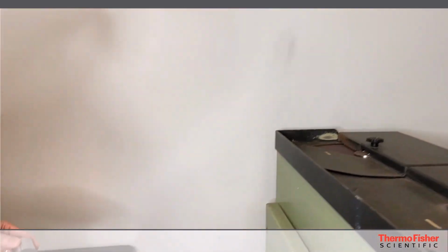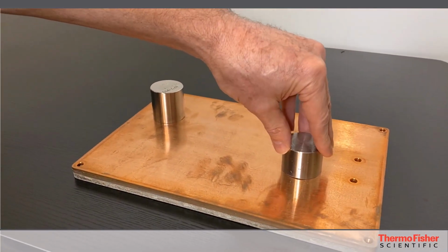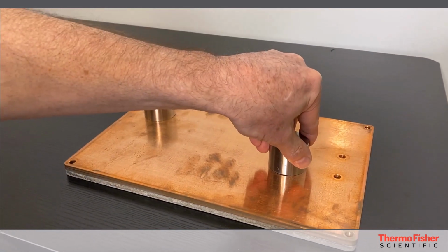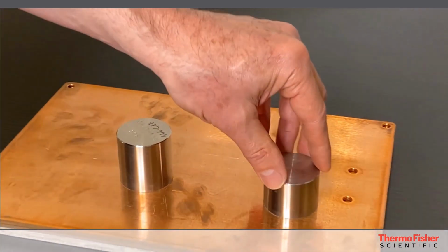Okay, so you're going to do this a couple passes, and you're going to keep seeing how you're improving. You can see it's already improving. And then each time you're going to come back to the copper plate, and you're going to see how good it is. And again, make sure you see where you're going to grip next. Okay, so now we've had a couple passes on there, and we got it to the point where I can rotate this around, and it's a nice even plane.